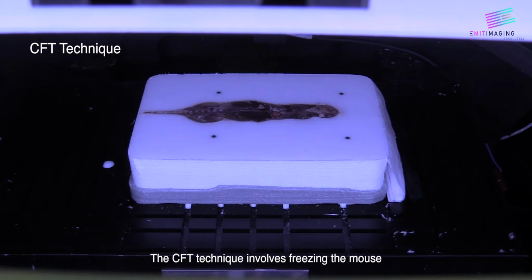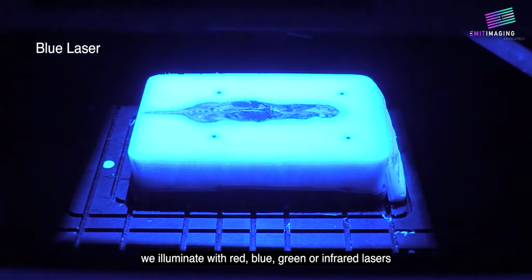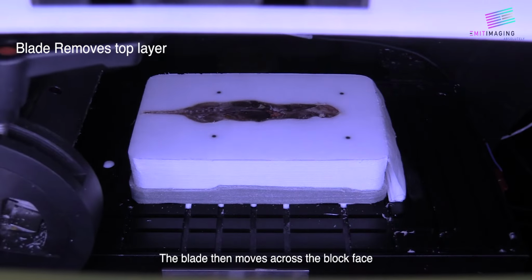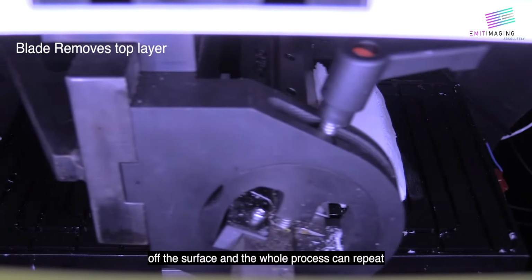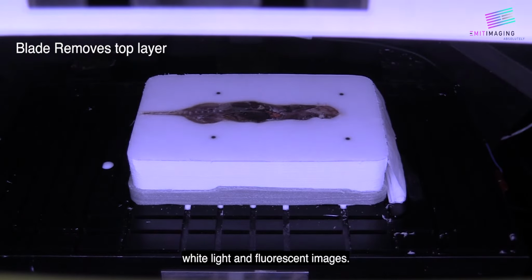The CFT technique involves freezing the mouse in a white block of OCT compound, as seen here. After exposing a surface of the tissue, we illuminate with red, blue, green, or infrared lasers while acquiring data off of the block face. The blade then moves across the block face, cutting a thin layer, 20 to 50 microns thick, off the surface, and the whole process can repeat hundreds or thousands of times. In this way, we build up a stack of white light and fluorescent images.